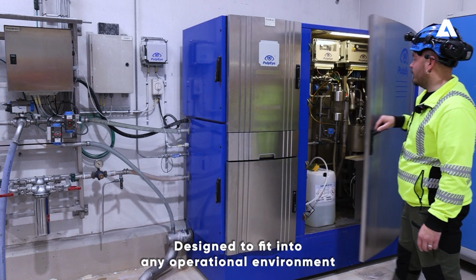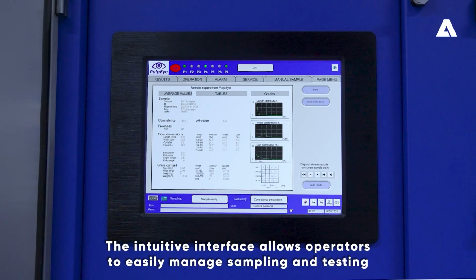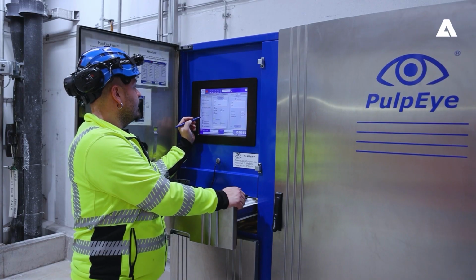Designed to fit into any operational environment, PulpEye supports both automated and manual sample loading. The intuitive interface allows operators to easily manage sampling and testing, ensuring a smooth workflow with minimal effort.